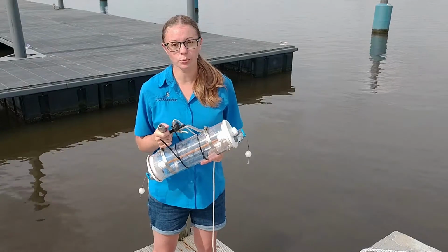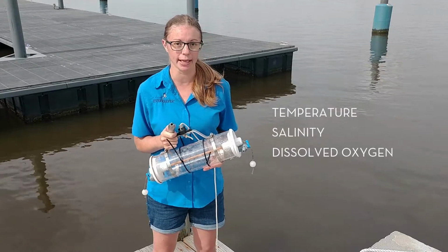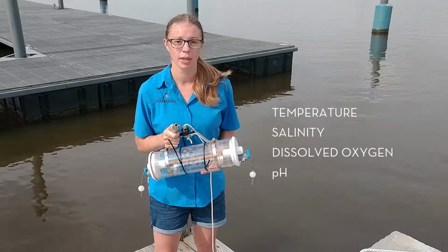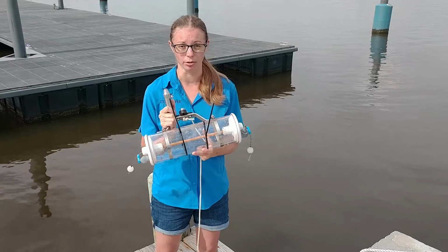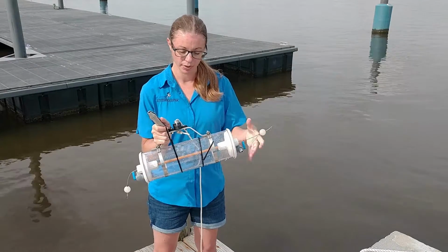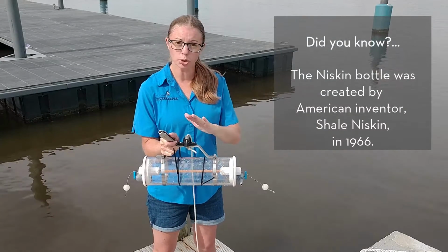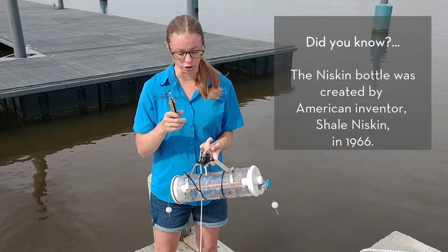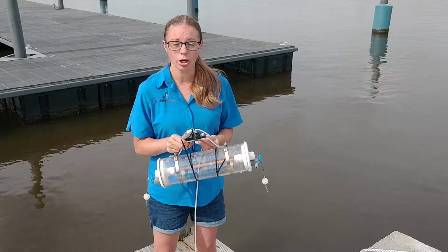The water quality parameters we're going to be measuring today are going to be temperature, salinity, dissolved oxygen, and pH. To get our surface water sample, I'm just going to use a bucket to skim the surface. But for the benthic sample, I need a special piece of equipment called a Niskin bottle. A Niskin bottle is just a plastic cylinder. It has stoppers on either end, and it's attached to a string. When I lower this into the water, the stoppers will be open, and when I've reached the desired depth, I'm going to send down what's called a messenger, and it's going to push a button, and it's going to close those stoppers. So let's go ahead and collect our water samples.